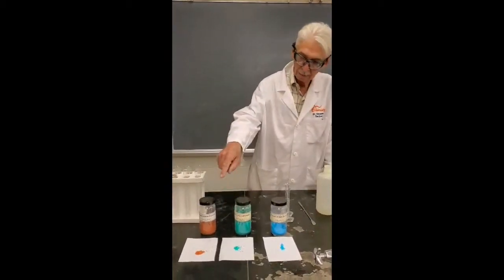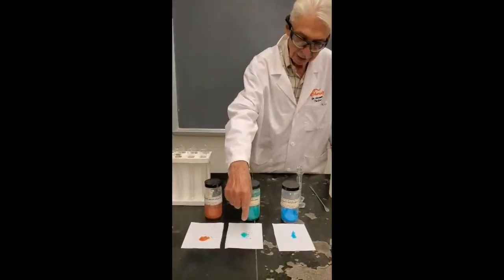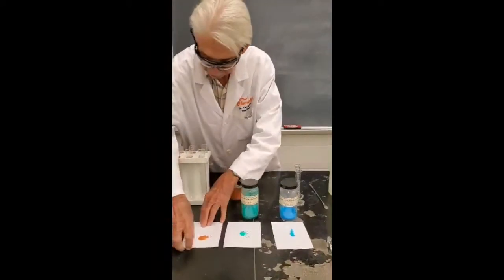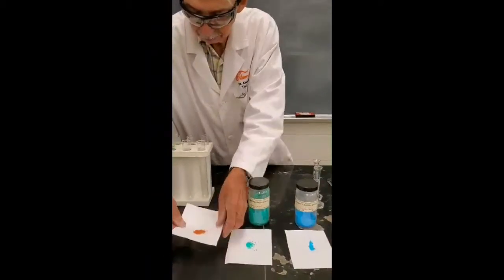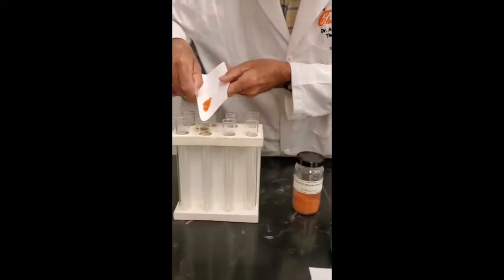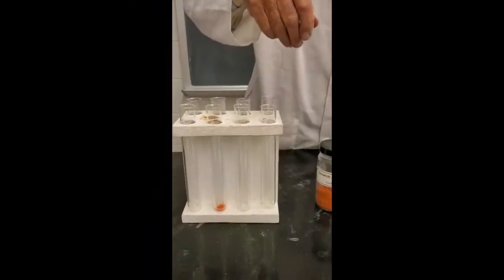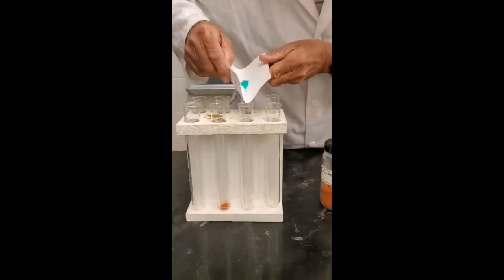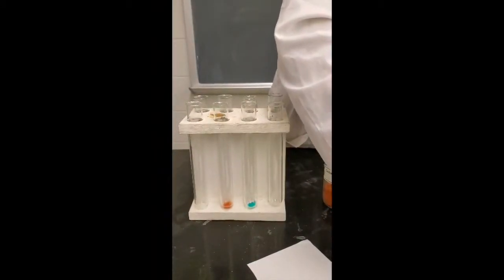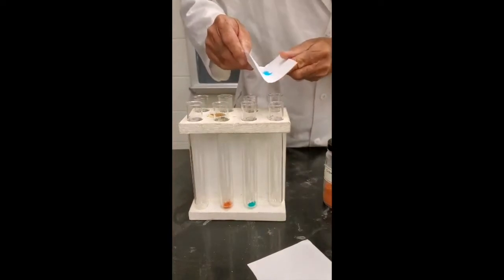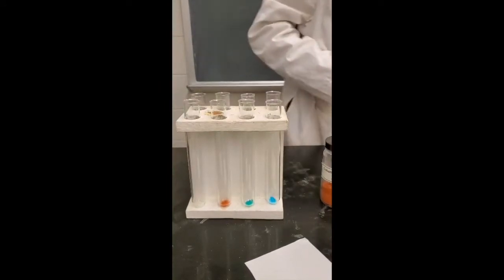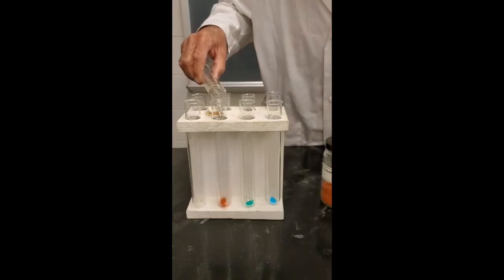And what I've done, I've weighed out 0.3 grams of this, 0.30 grams of that, 0.28 grams of this. I'm going to put them into these test tubes over here. Hopefully, I don't spill them. That's the cobalt-2 one. And this is the nickel-2. And this is the copper tube. When it gets in the solution, there will be two more water molecules that will attach to the copper. Now I'll add 10 milliliters of water to each. They're all soluble in water.